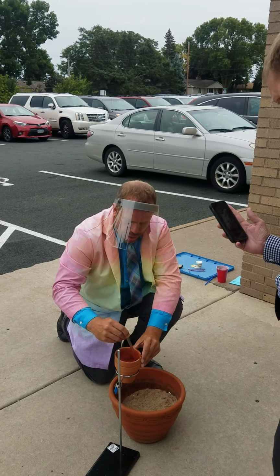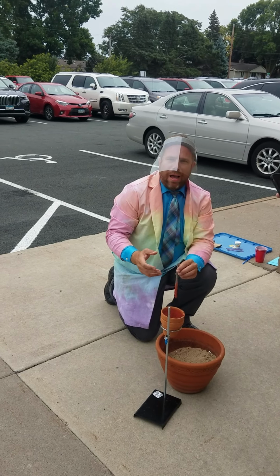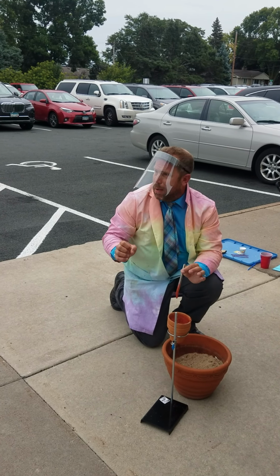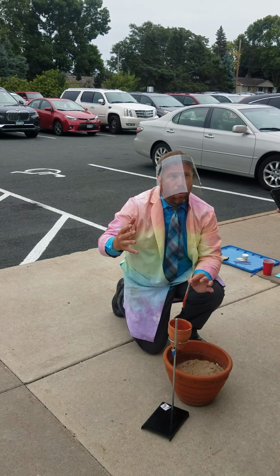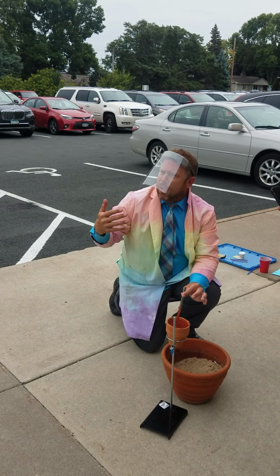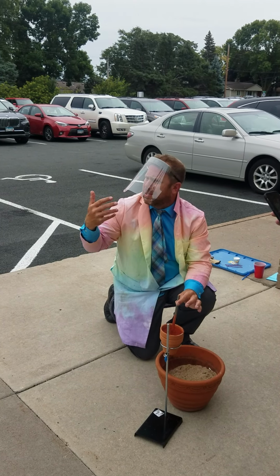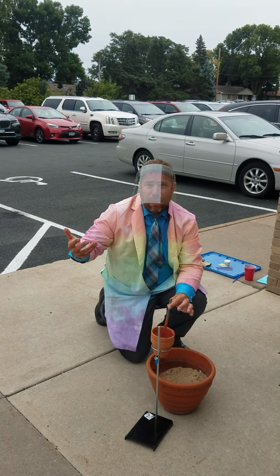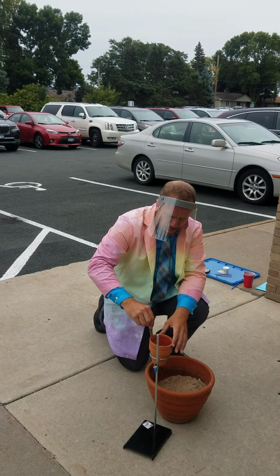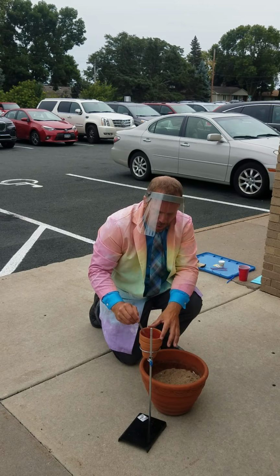Now, has anyone wondered in chemistry why there hasn't been an explosion? Sometimes when you mix 2 things in chemistry, boom, and I'll show you that this year. But it's not reacting, is it? So what do we need? Anyone know the word? We need something to get it going. What do we call that in science? Catalyst. A catalyst. Very good, Mr. Sawyer. Mr. Sawyer is with us today too. So we need a catalyst to get it going.